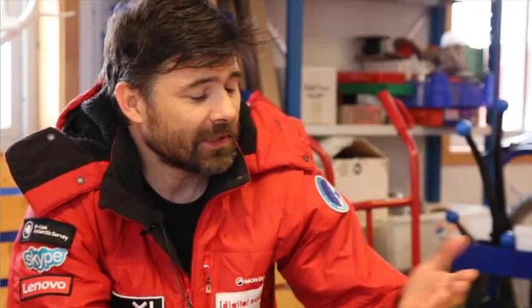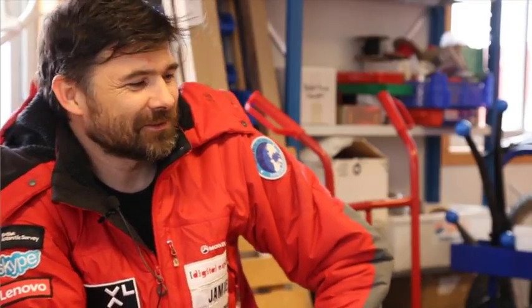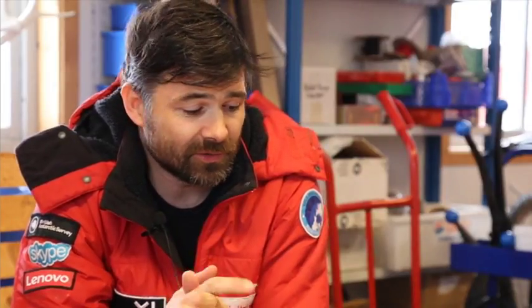Who has a calculator to hand? Because my brain is frozen. What do you reckon, Ellie? Have you got a calculator over there? About 3,500. Fantastic. So that's the kind of way that we're doing sampling. I just want to take you outside to show you where we've been sampling before we come in and answer some of your questions.